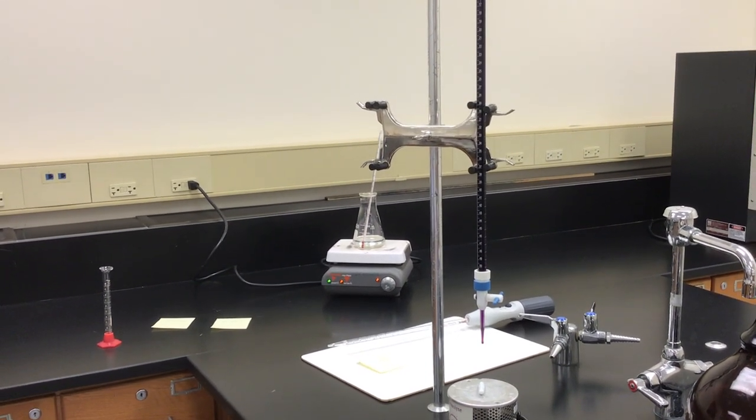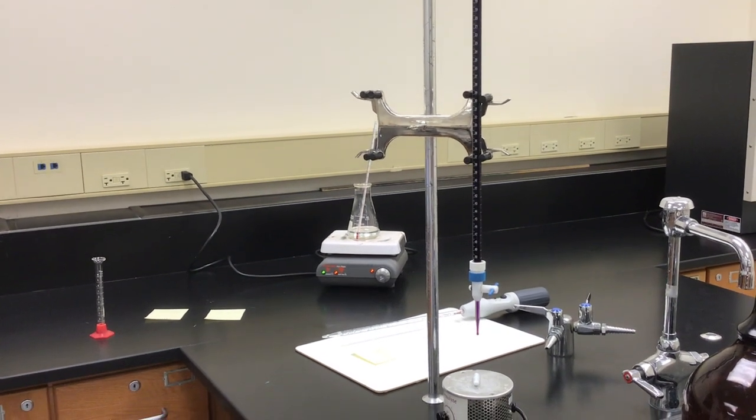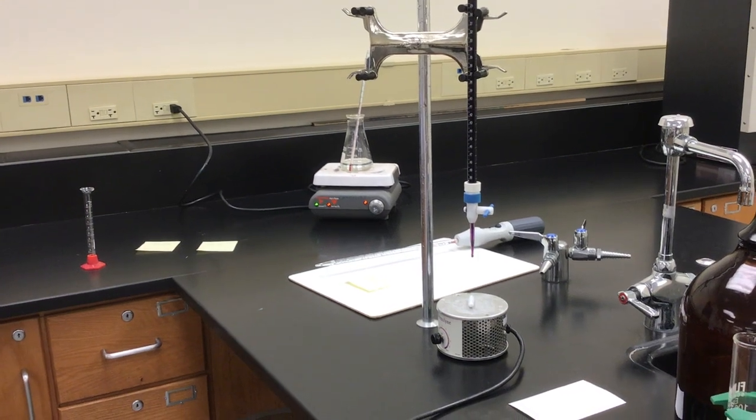I have currently set up a titration apparatus. So we have the burette there. Underneath the burette, you can see I have an auto stirrer.